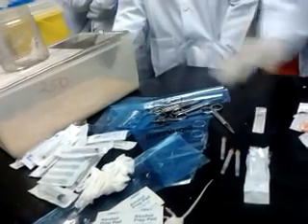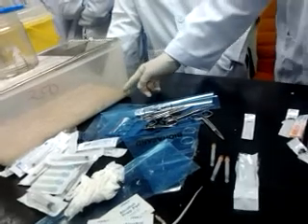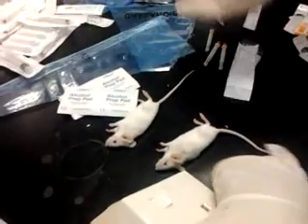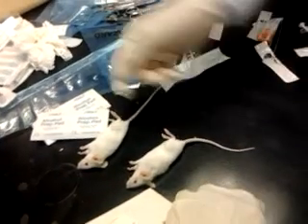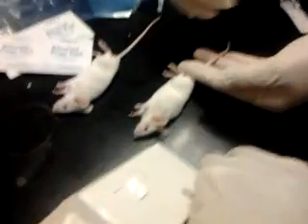Why don't we use bedding when we do anesthesia and leave the animal inside? Because they will inhale a lot of wood shavings or dust and it blocks the airways. So normally we don't put wood shavings, we put the animal into a clean, empty cage under anesthesia. If you want to use IV on this rat, you can. After giving subcutaneous or IM, you can look for the vein and then give IV.